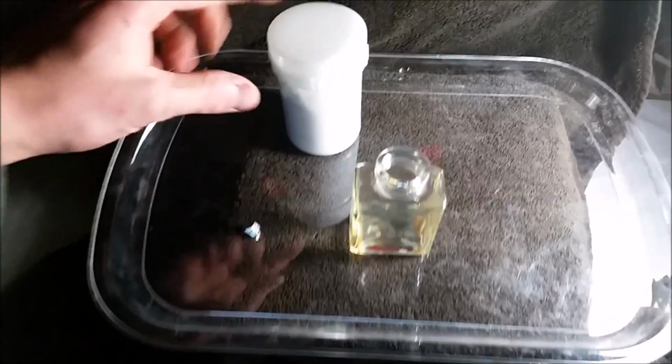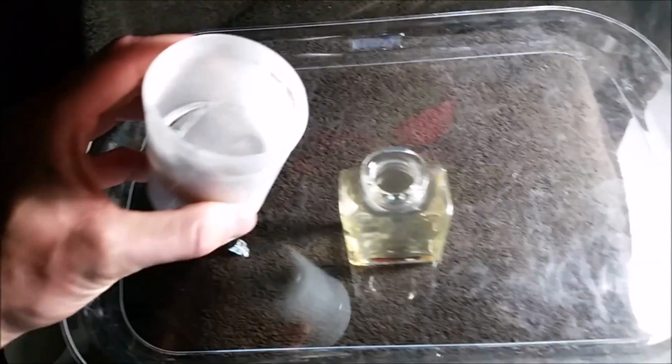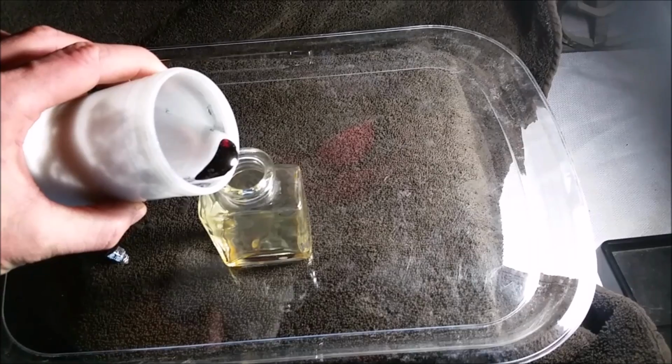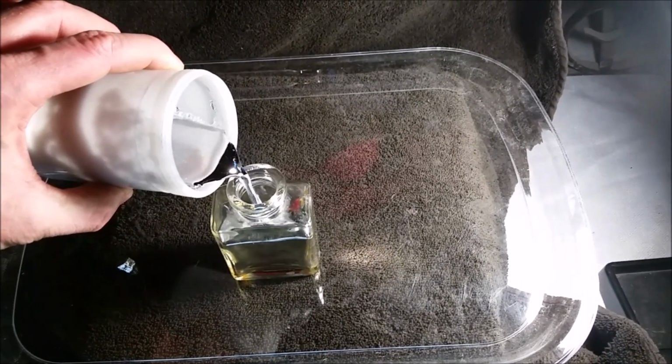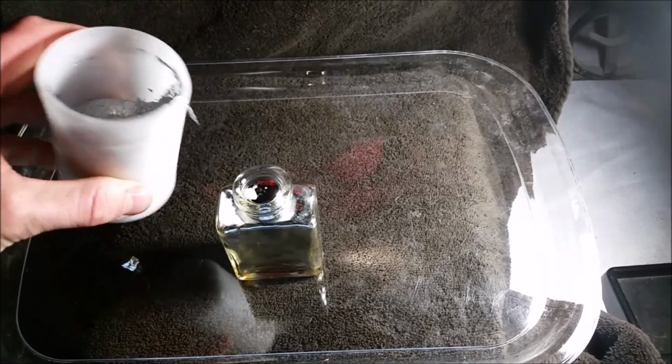So I have over here a container full of liquid gallium. You may notice that this container is plastic. This is because they recommend not storing gallium in glass or metal containers. This is probably a pretty sound piece of advice, but I'm really curious to see what would happen if I tried to store my gallium inside of a glass bottle. And there we go, I've filled it all the way to the top.